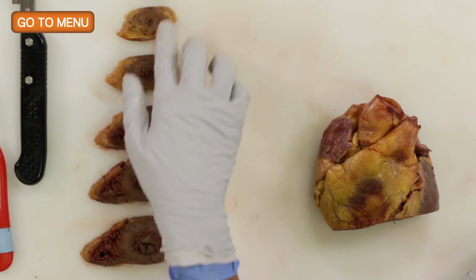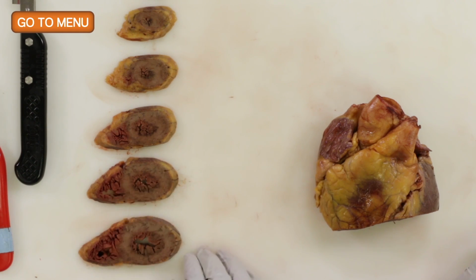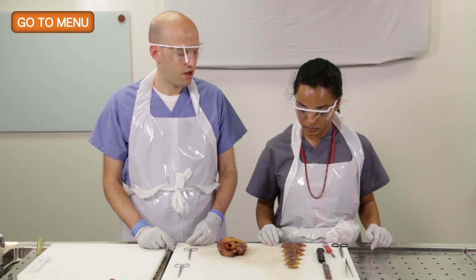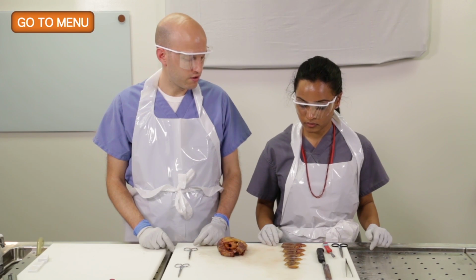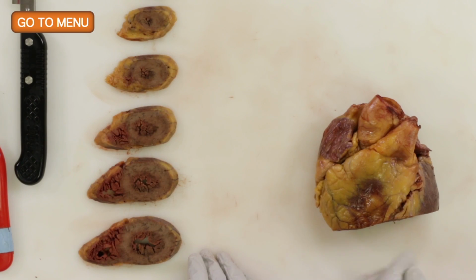Nope. No, so this looks pretty normal. There might be a little bit of ventricular thickening, but no areas of acute or chronic infarction, I would say. And another cause of acute death can be significant right ventricular thinning, which is called arrhythmogenic right ventricular dysplasia. This patient also does not have that because it's paper thin in those cases, and they have a clinical scenario of acute sudden death. So that wouldn't fit with this patient either.